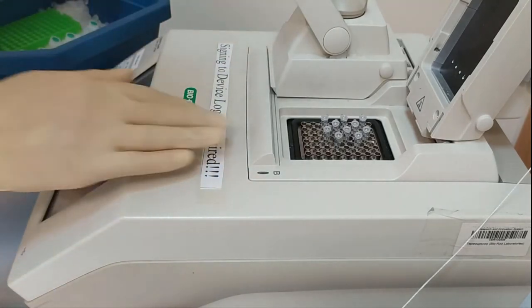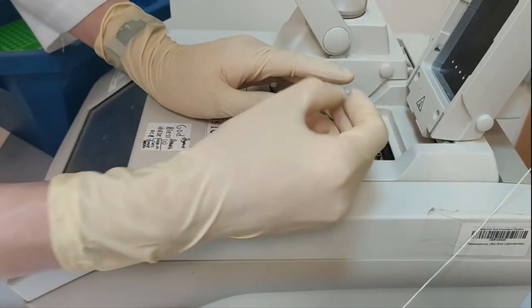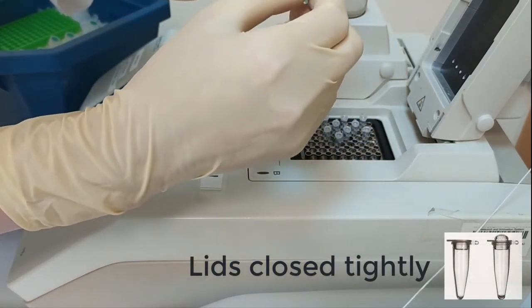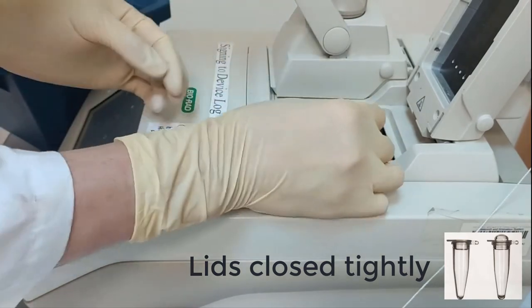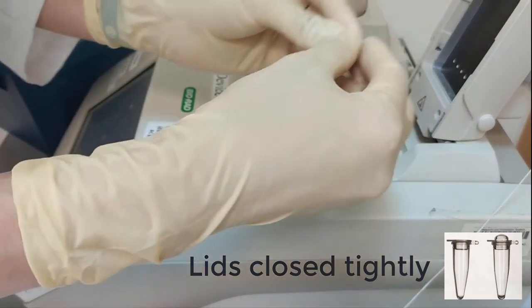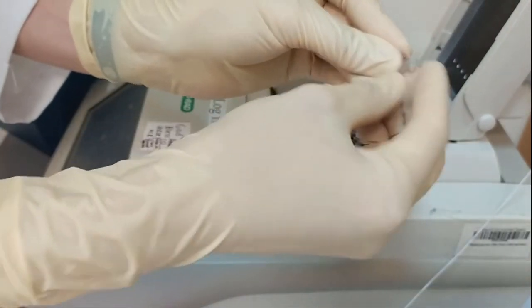So now it's clear that everything is set up. Also you should always check that your lid is closed properly. So let's check them now and all the lids should be closed. Like here.